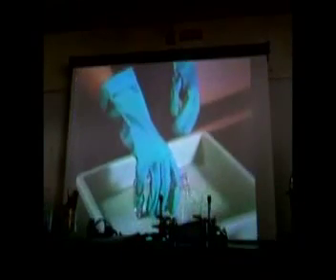Even if you're not fooling around, accidents can happen. Personal belongings in the middle of aisles can trip someone. Even a job as simple as reading a burette can lead to an accident. For greatest accuracy, your eyes should be on the same level as the number you're reading. If you can't read a burette accurately, lower it down to eye level. If you can't do that, stand on a step stool.